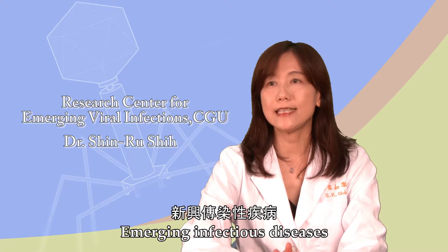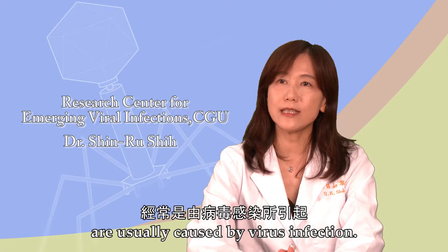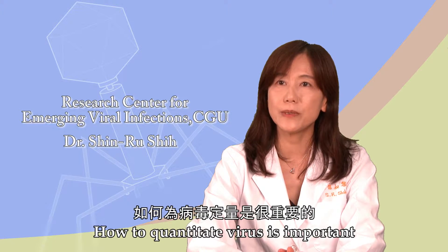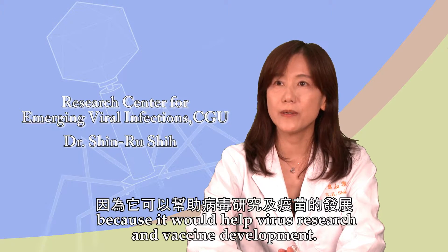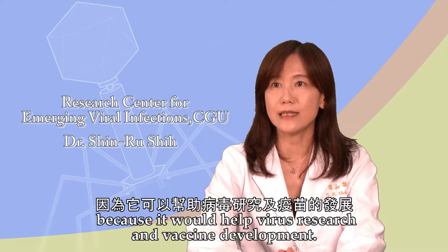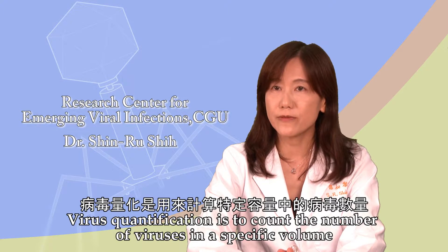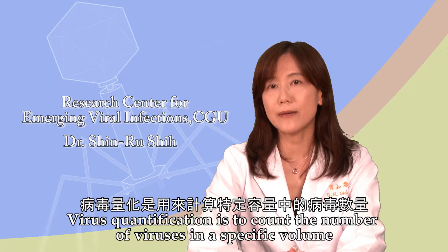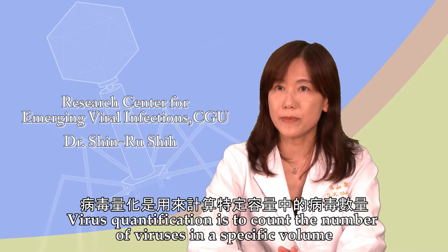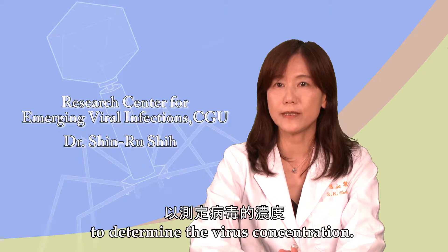Emerging infectious diseases are usually caused by virus infection. How to quantitate virus is important because it will help virus research and vaccine development. Virus quantification is to count the number of viruses in a specific volume to determine virus concentration.